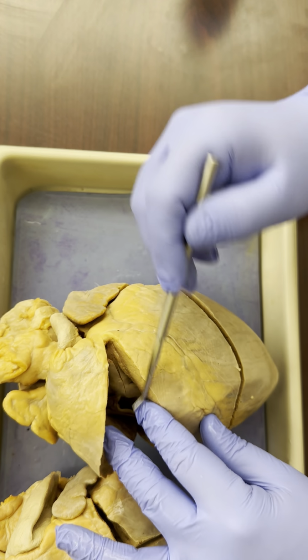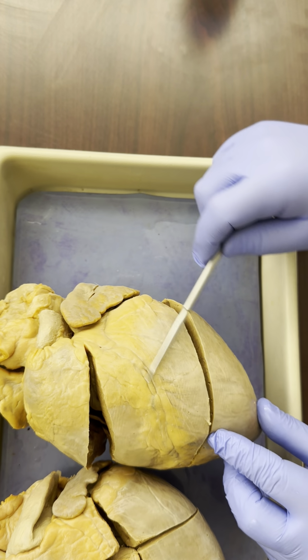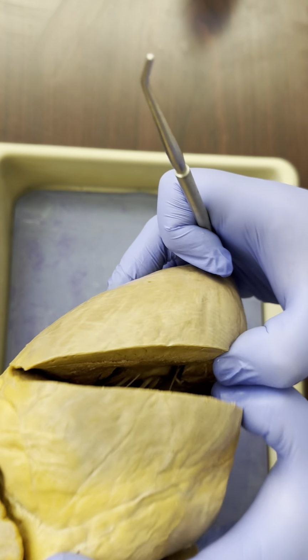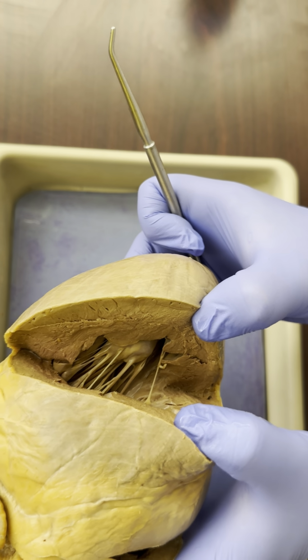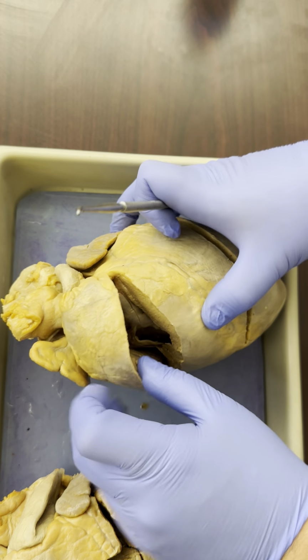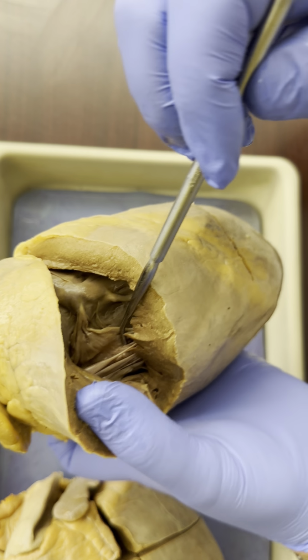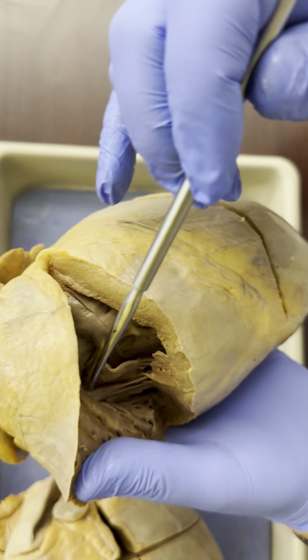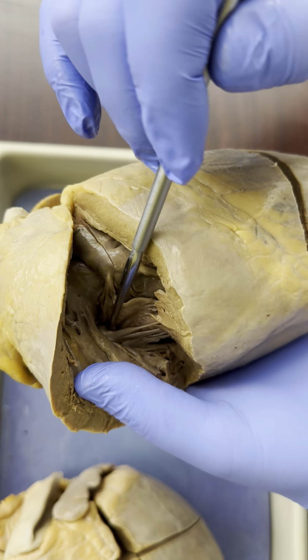So here is the right ventricle, and again, it is everything in this diagonal direction from the coronary artery. Now, here let's open up the left ventricle, and you can see just how much thicker the left ventricle is. So what can we be asked inside the ventricles? Well, it depends on the cut and what you can see. Here, we can see some chordae tendineae, these little strings right here. And they are attached to some muscle right here that is kind of a raised bump.